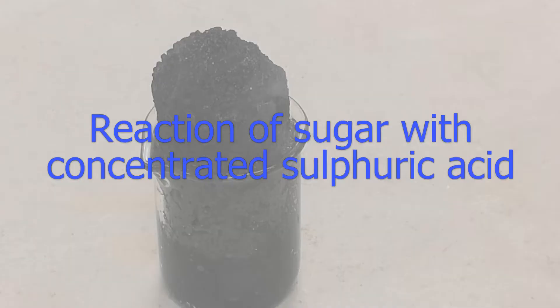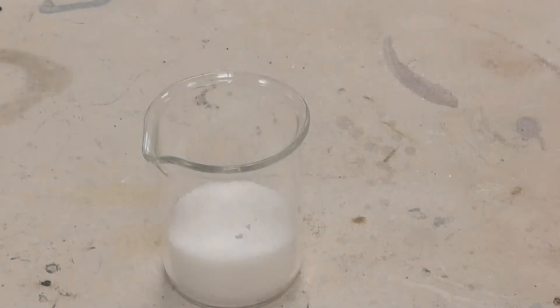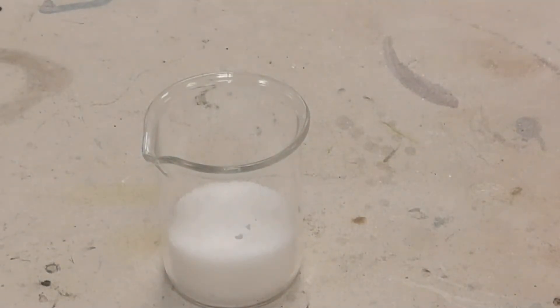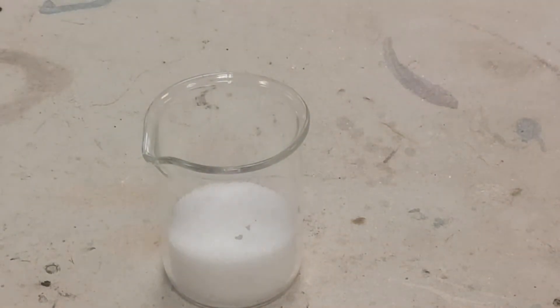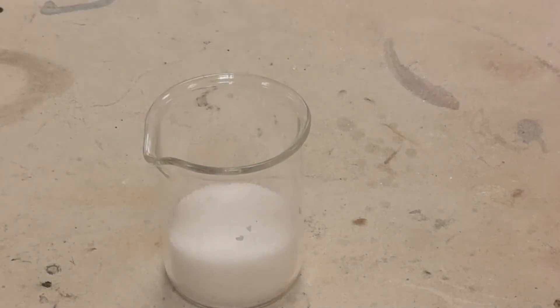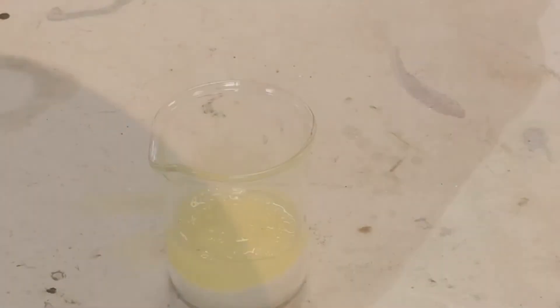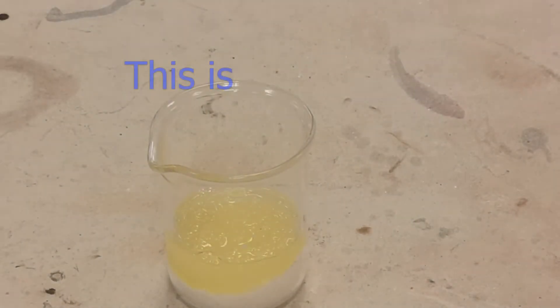When you add some concentrated sulfuric acid to sugar — sucrose, ordinary household sugar in this case — an interesting reaction takes place.